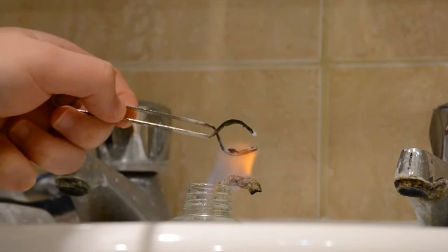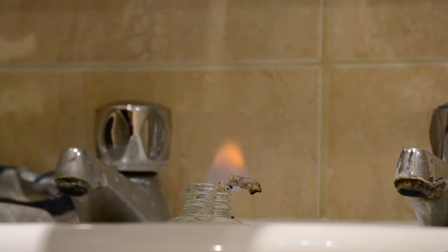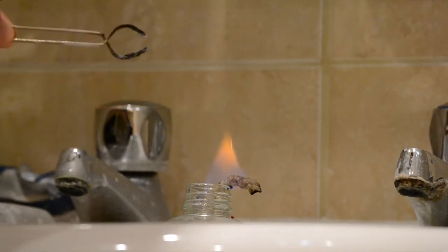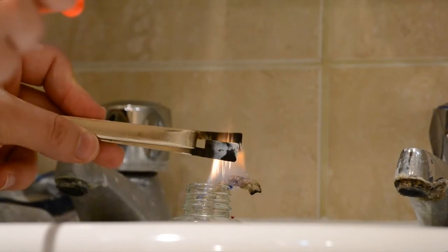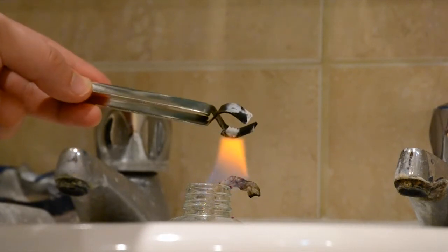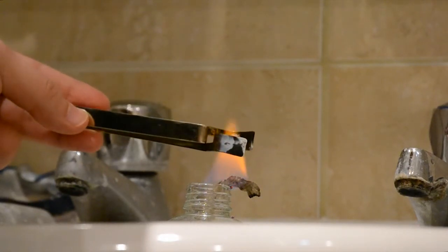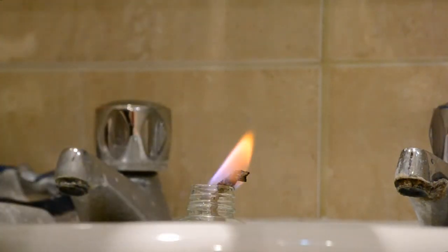Cobalt chloride is not a common flame test, and it takes a while to ignite, but when it does you can see it reacts similarly to the iron filings. Potassium iodide has a much more subtle effect. I really wish I had a clearer flame to repeat this with, but if you look carefully you can notice the lilac licks the flame takes when it starts to ignite. The lilac flames continue sporadically for quite a while.